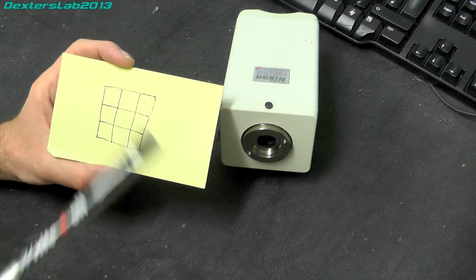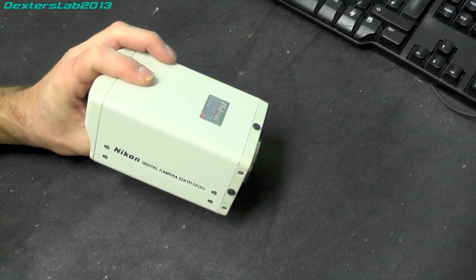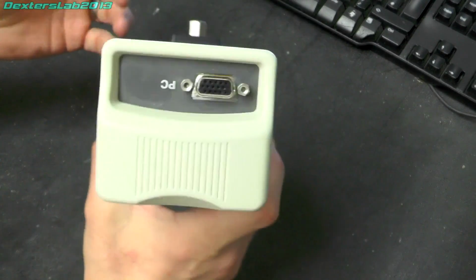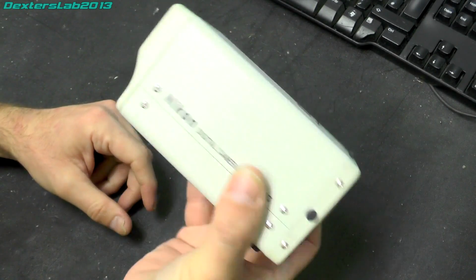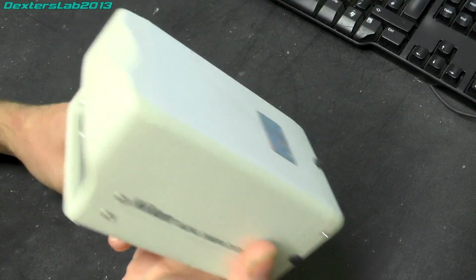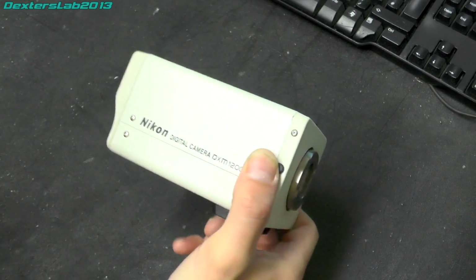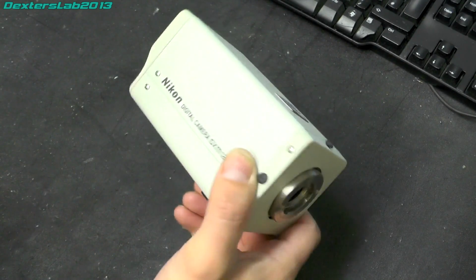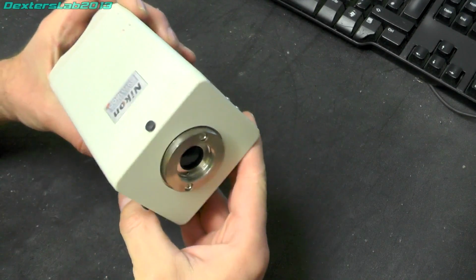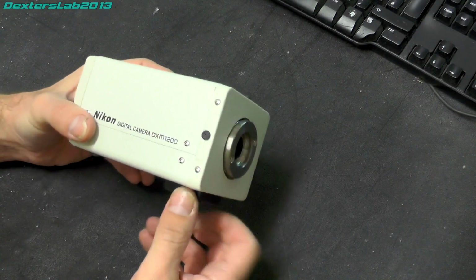Yeah, I would imagine piezoelectric is probably what they're using. So when I pick this up, there's no interface card with it. It's literally just the camera on its own. You never ever seem to get the interface card with these types of camera. I know microscope stuff has had things like this before, and you never ever get the interface card. I think there's some kind of repulsive force between the camera and the interface card. They always want to repel each other and disappear into their own separate domains.